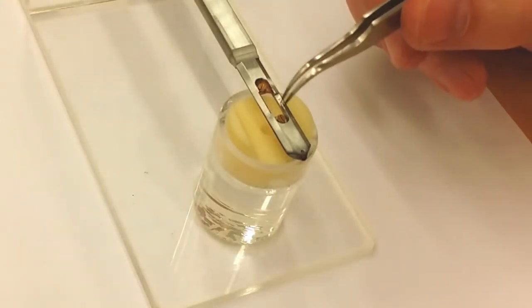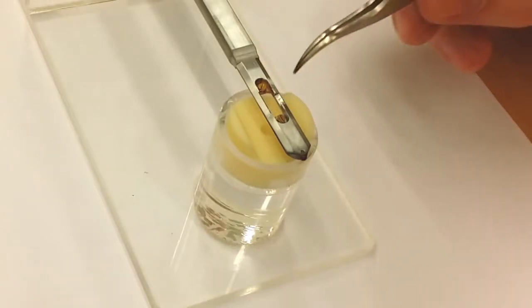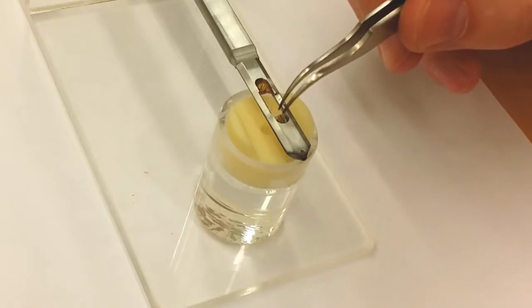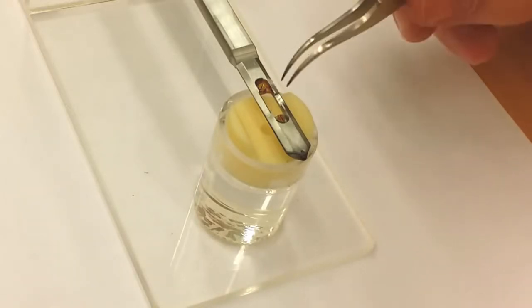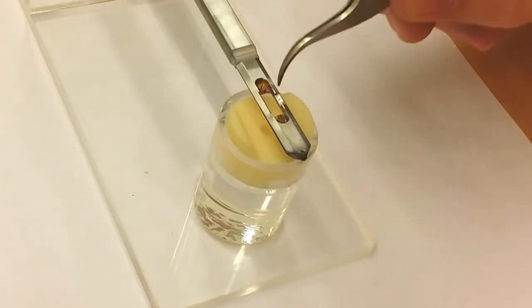This sample holder, instead of the previous one with the clamps, only has 2 screws. So here you need to have some pre-configured sample that you can screw and attach with these screws. These are usually used for metallic samples that are polished down to the required thinness.